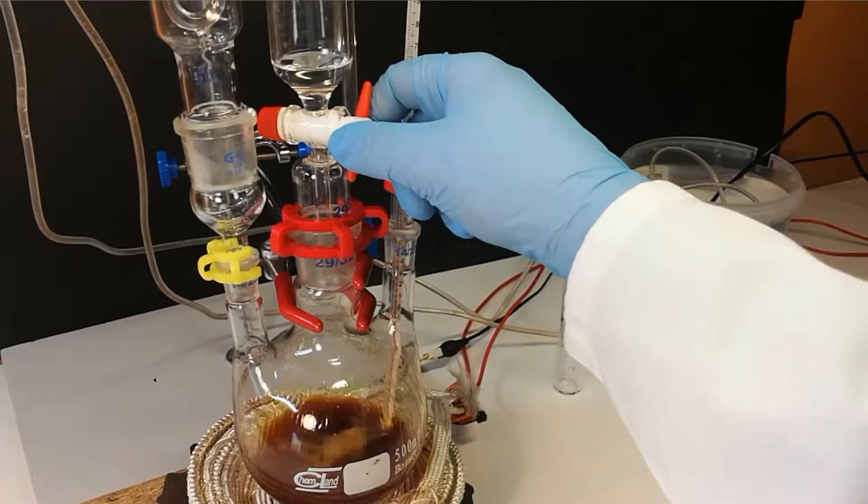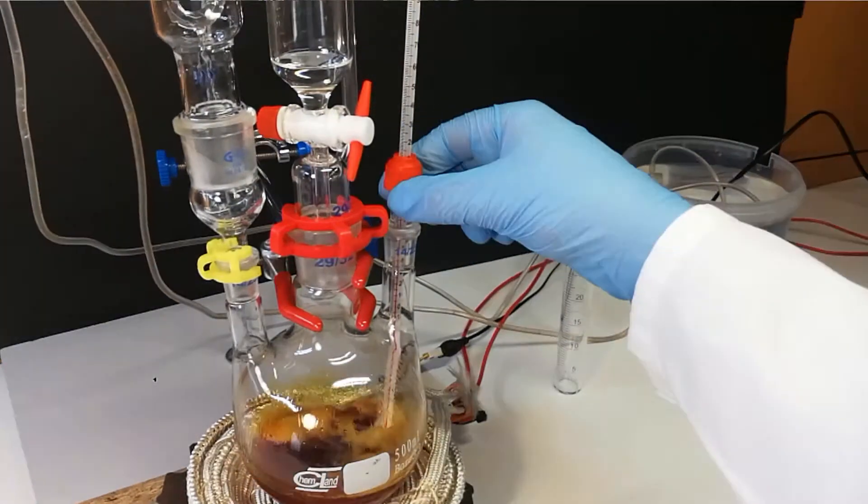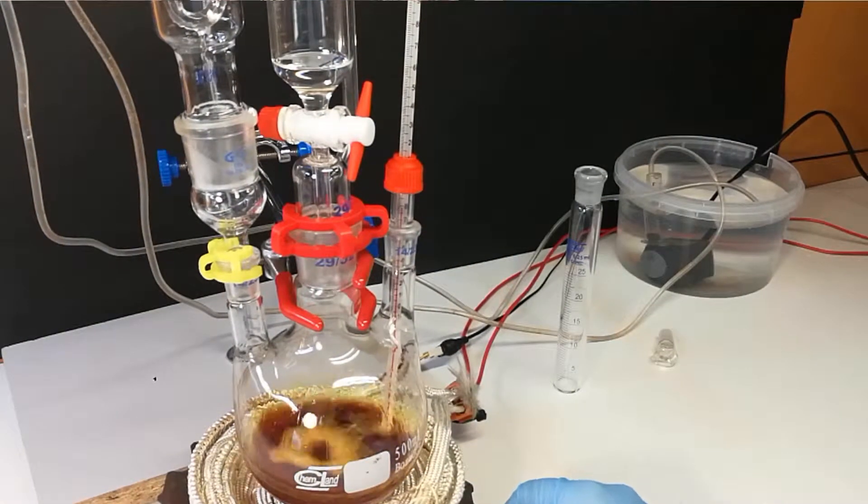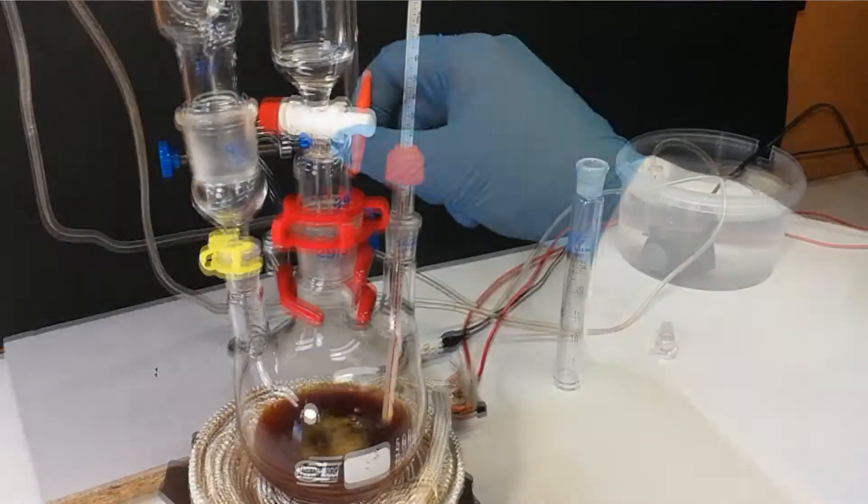In this footage you can see how important the condenser is, because this reaction is very exothermic. There is no other heat source.